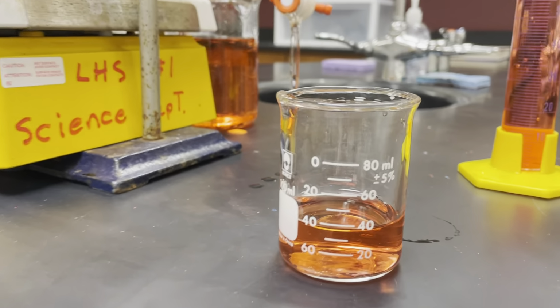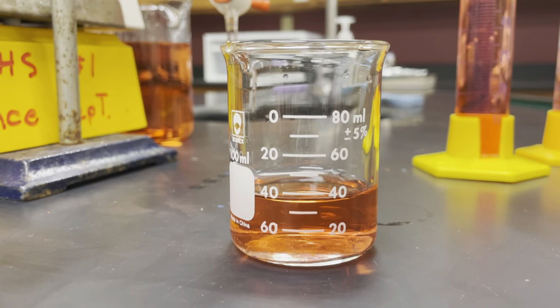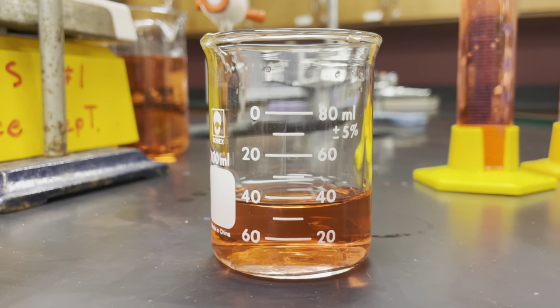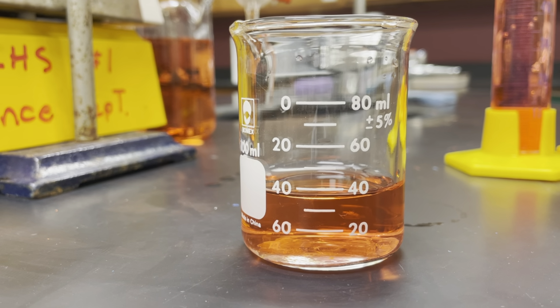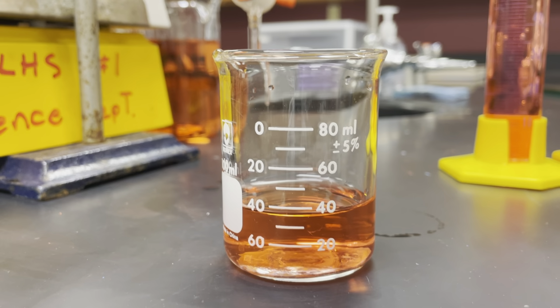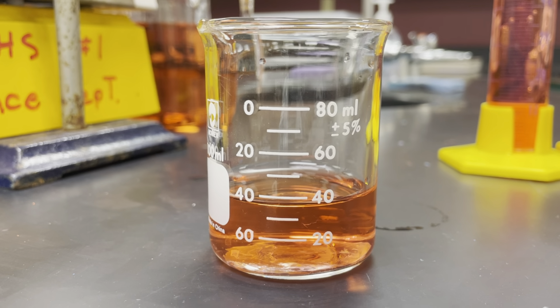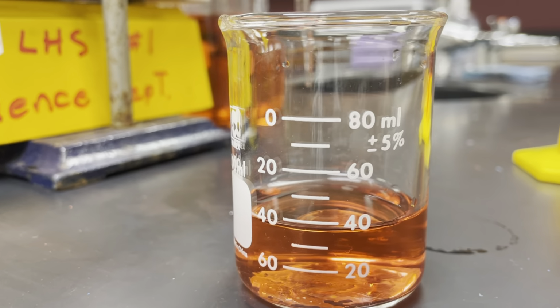So this beaker has these lines, which we sometimes call demarcations or graduations. These lines are either going one way or the other. You can either look at it like on the right side, which we would mark as TC, or to contain. This tells us how much liquid we are containing in this beaker, and we're measuring volume here. This is measuring in milliliters, as it shows by the little ml.